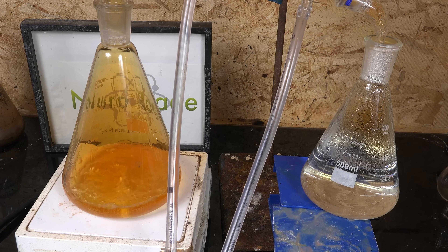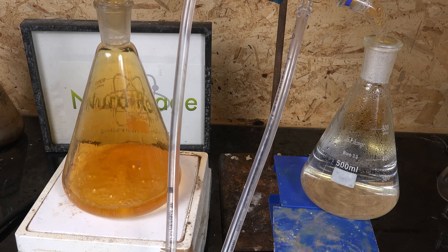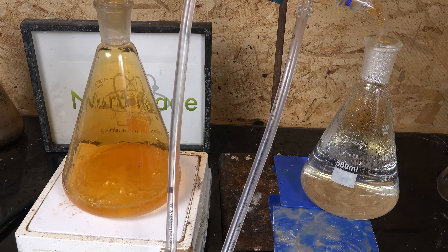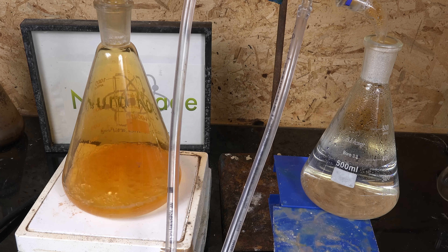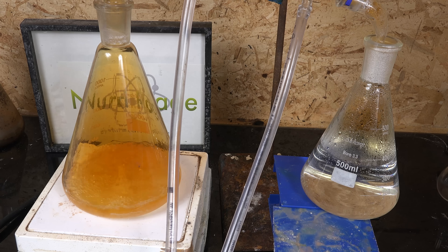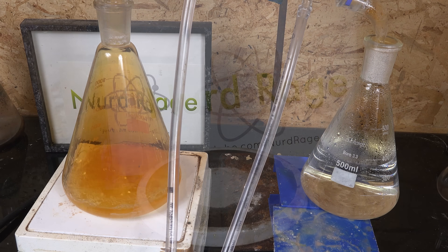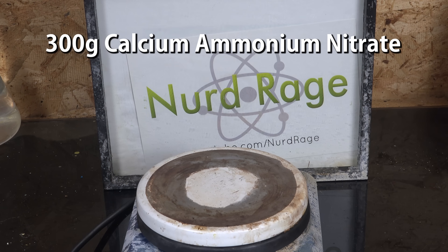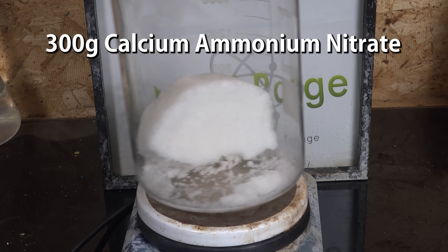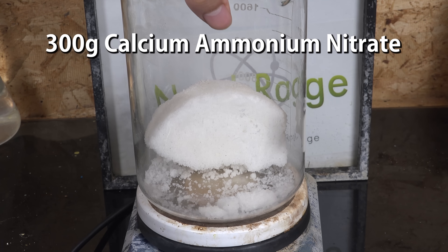So the question naturally arises: if the more sought-after nitric acid could be obtained this way? And indeed it can be, and that's what we'll be exploring in this video. First we start with 300g of calcium ammonium nitrate, which is easily obtained as a fertilizer.